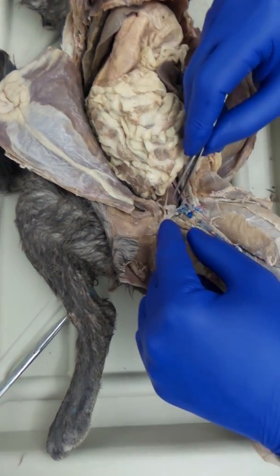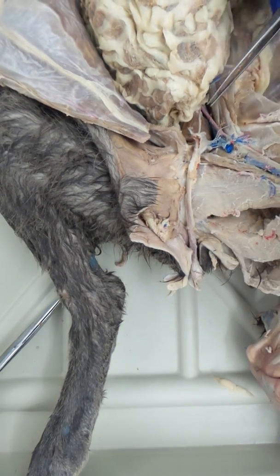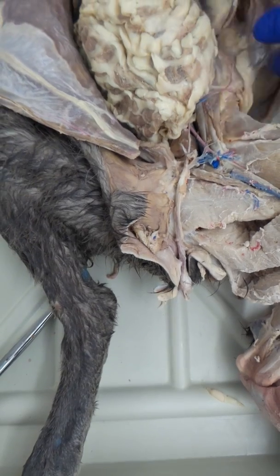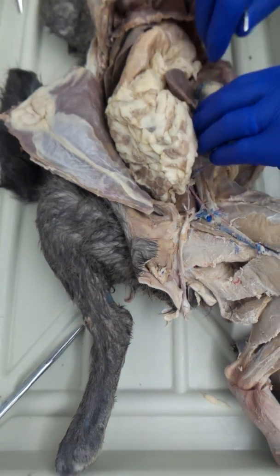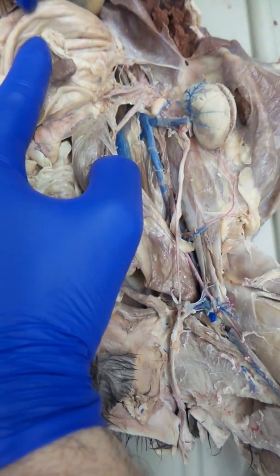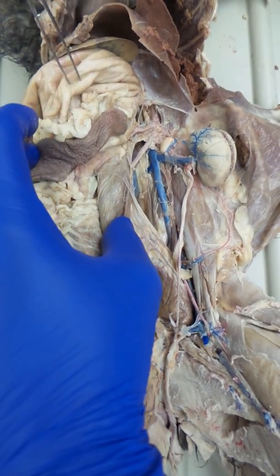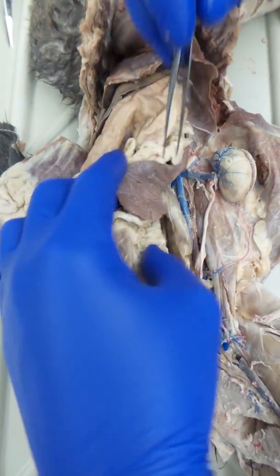As you're working down, you want to be careful not to catch some of these fine structures like parts of the spermatic cord, the spermatic artery, things like that. I like to clean things so that you can look at everything on the left side. And so what we're looking at here, there's our diaphragm. I'm lifting the stomach, which is right here. You can see some of the liver there and the spleen.